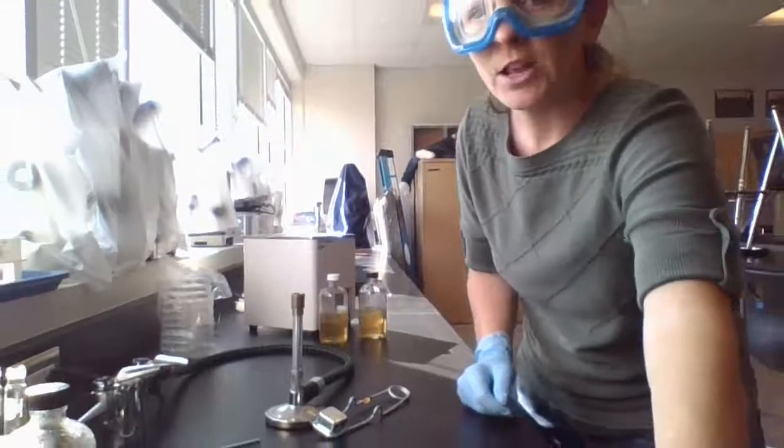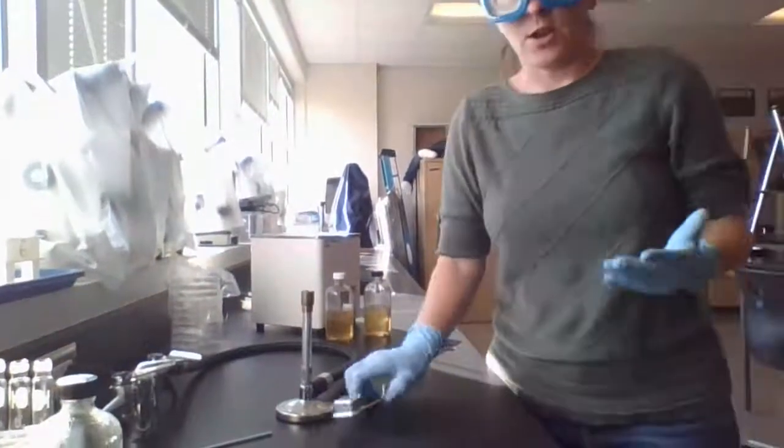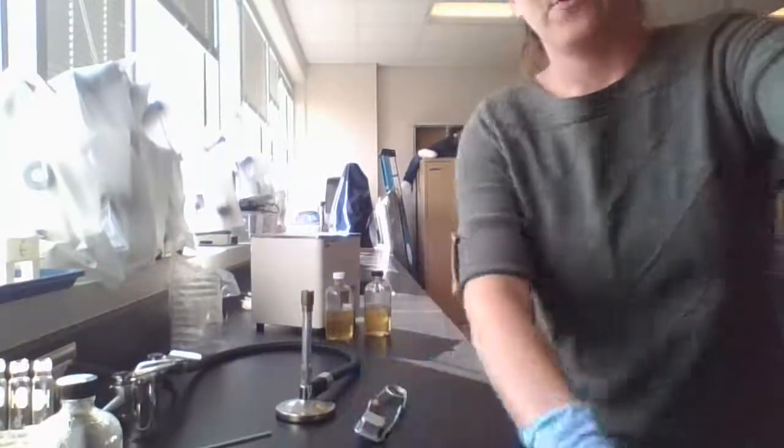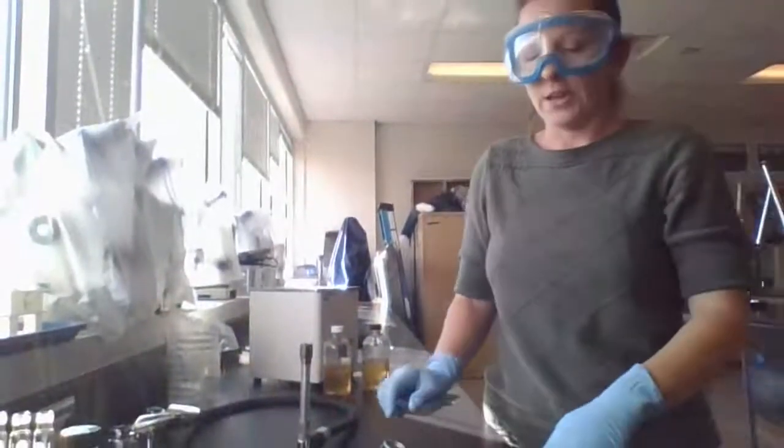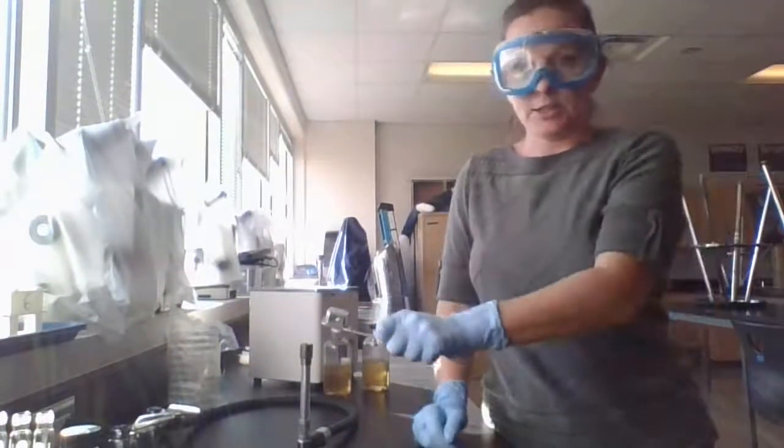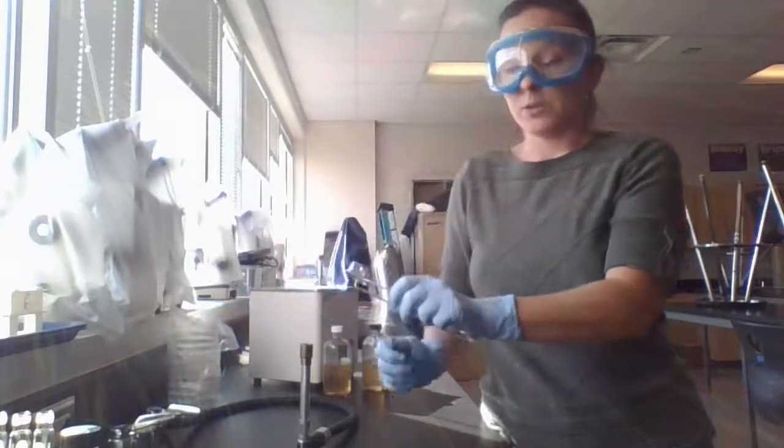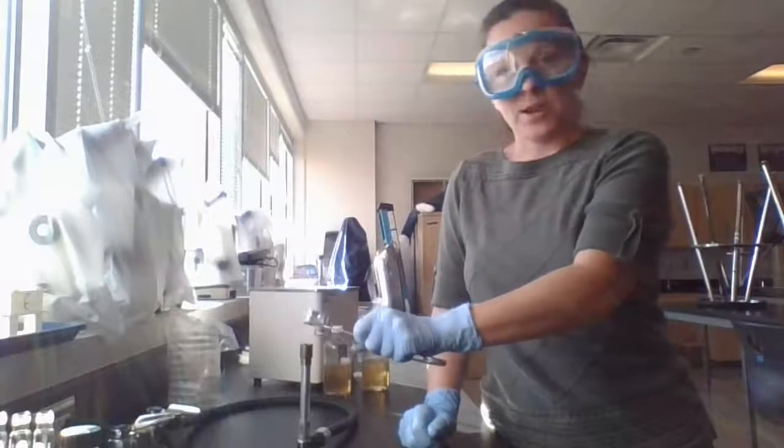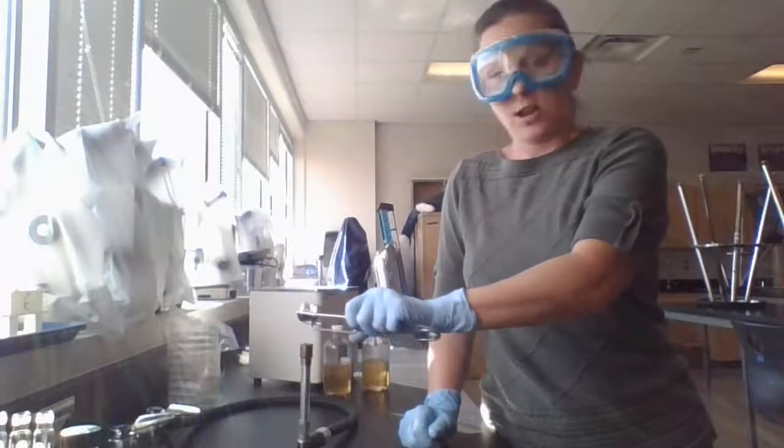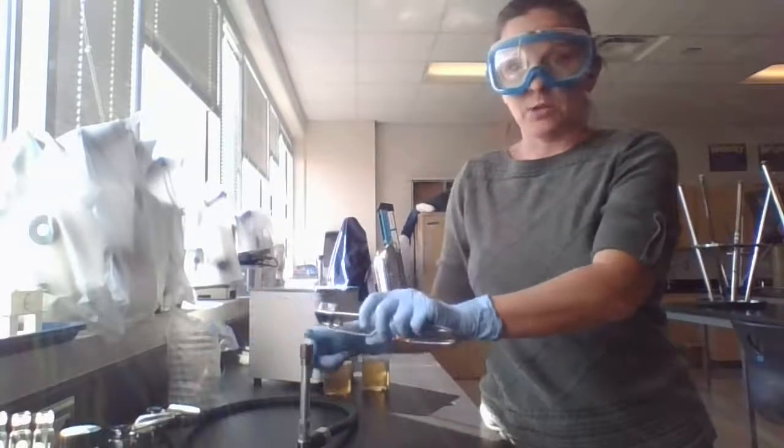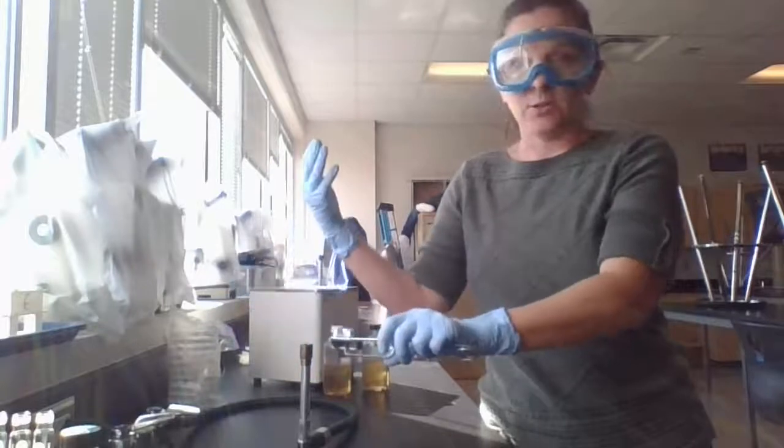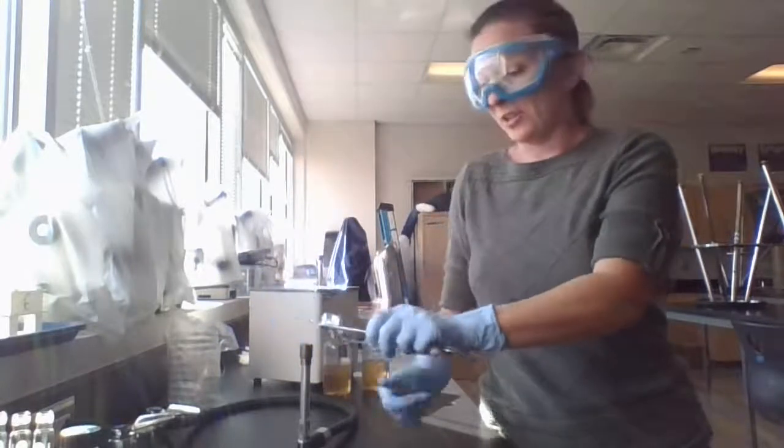So we always want to make sure that we have our striker or if we're using just a general lighter, that we always have that ready to go. Now, if I was using a lighter, I would light here first and then I would turn this on. Since I'm doing the striker, I kind of want to make sure I maintain at least a couple of good strikes around the time that I'm turning that on. And you don't want gas to sort of fill up the room before you've actually allowed it a chance to light.